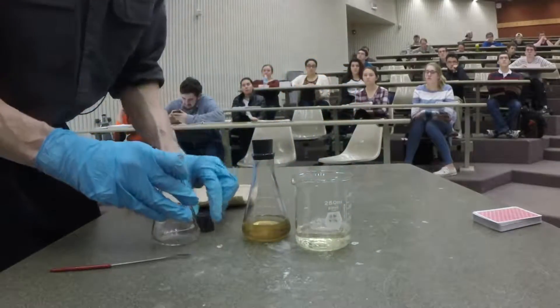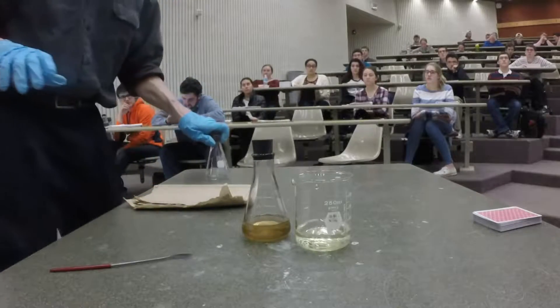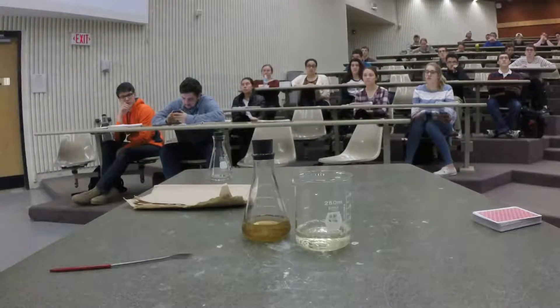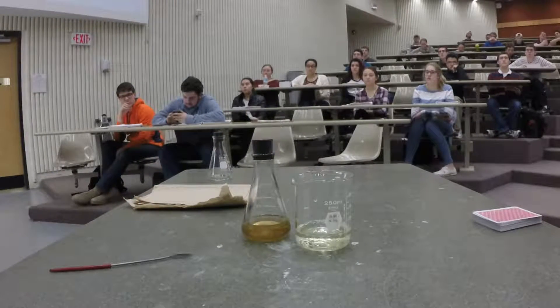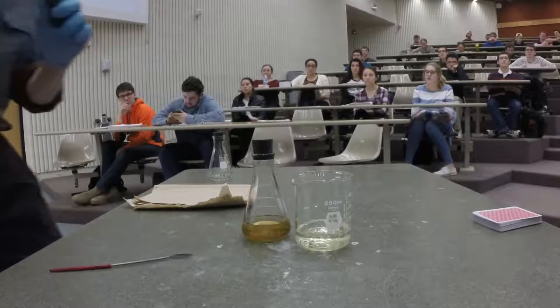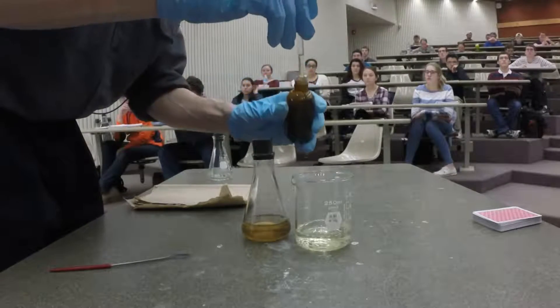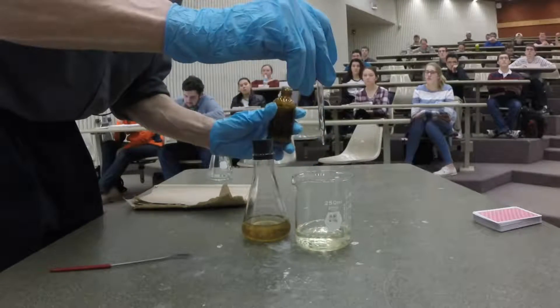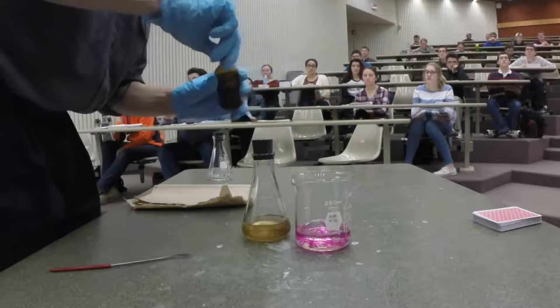It might be a little easier to see. Since it's an amine, it is basic. So I'm going to add a little phenolphthalein to this to help us see what's going on. One drop of phenolphthalein and we get a pink color.